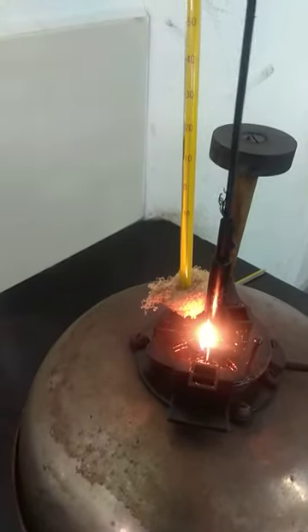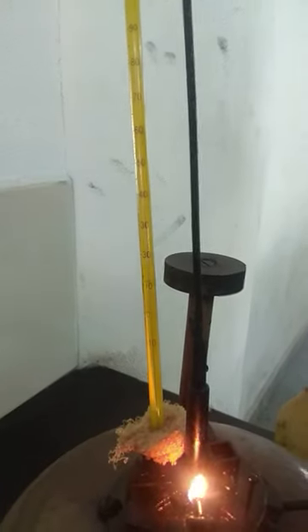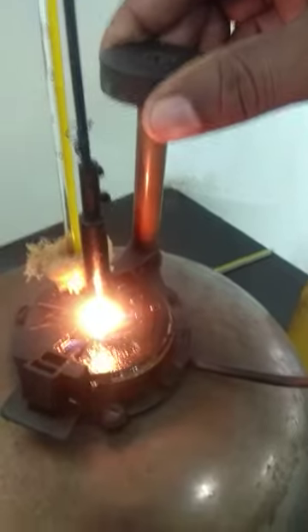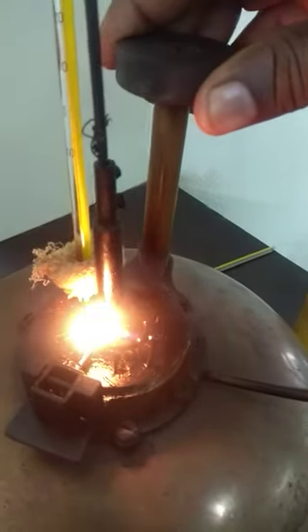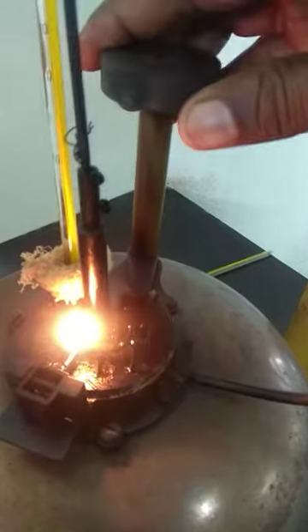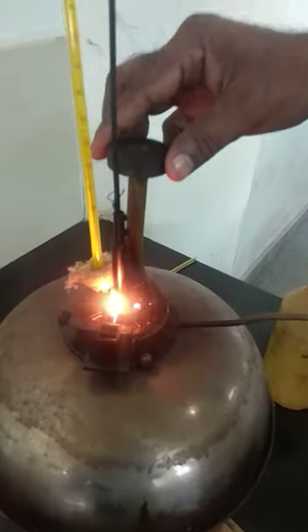Keep noting down the temperature — you can see the temperature is increasing. Through this, we open the orifice to check whether a flash is occurring at this temperature. You can see we are opening the orifice so that the lamp can check whether a flash is occurring. We see no flash, so we write down there is no flash at this temperature. The temperature is now 45 degrees Celsius.